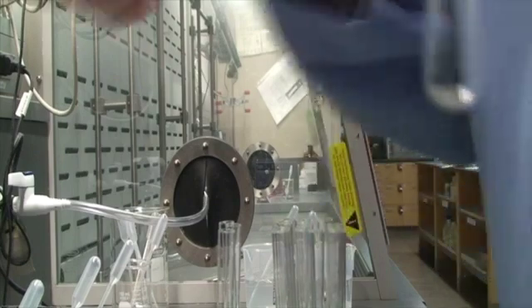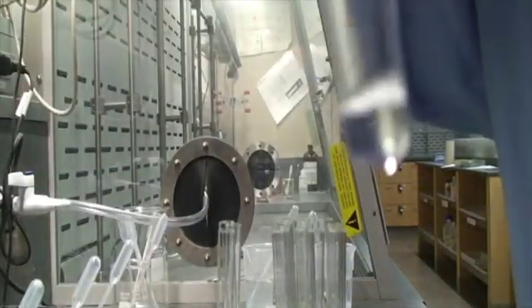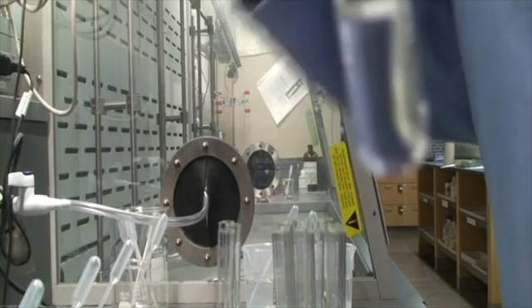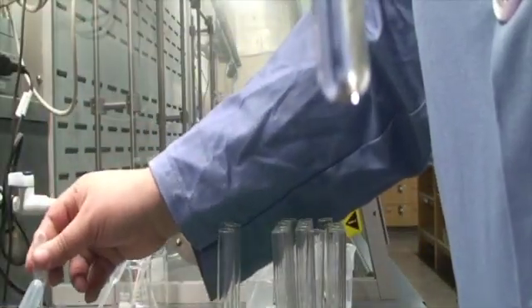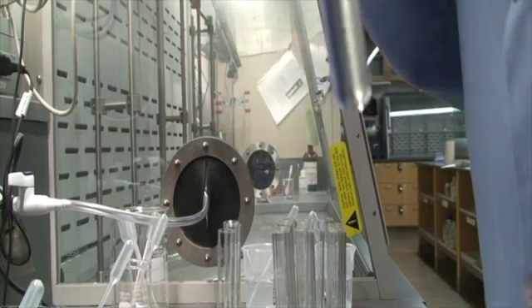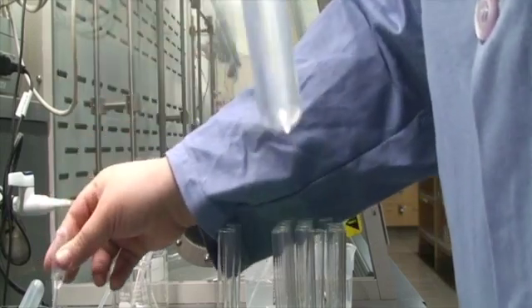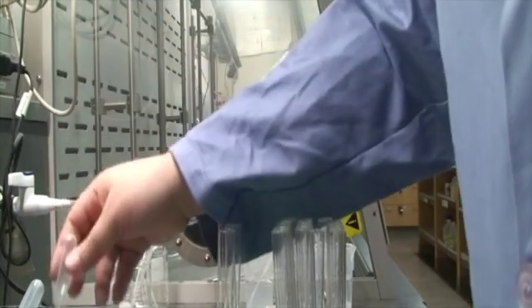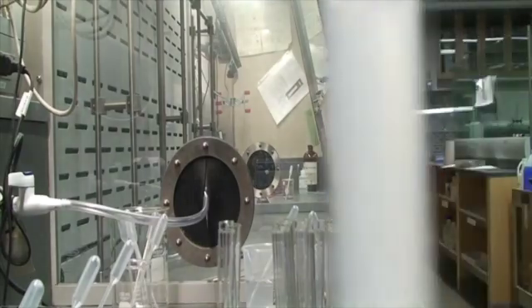Alright, let's do 8 plus 12. And we certainly have a precipitate there.